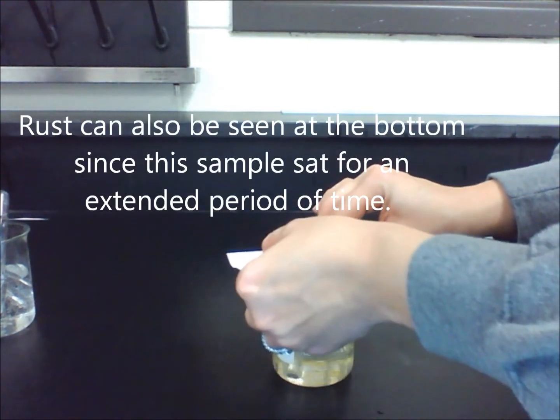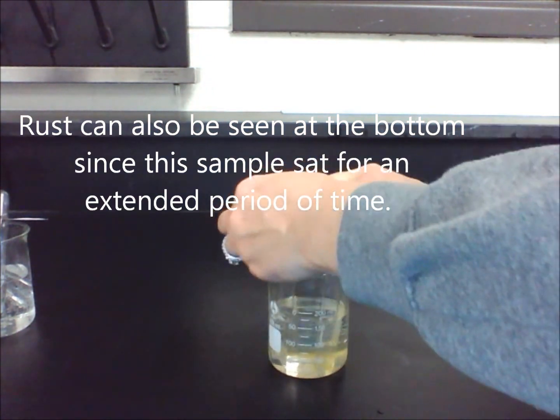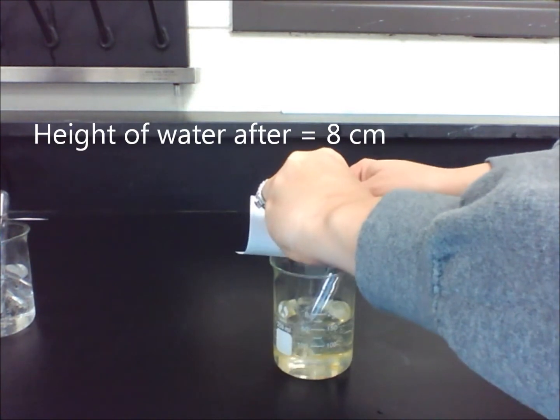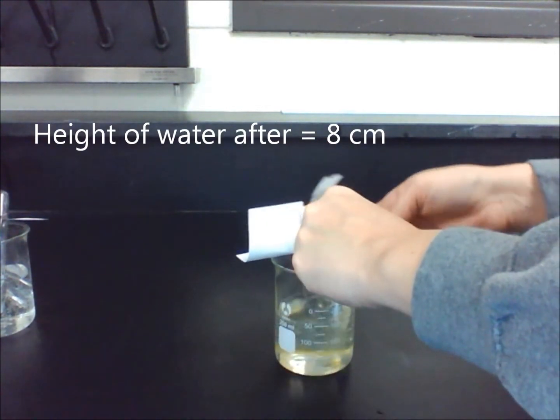The reason the water level is rising is because the iron is reacting with the oxygen in the air, causing the water to rise and taking place of the oxygen that was previously occupying that space.